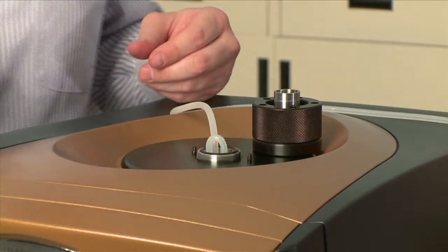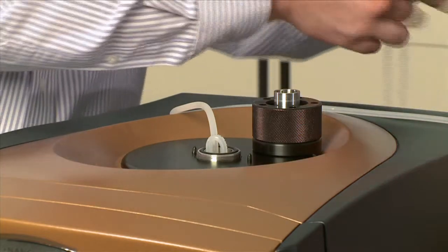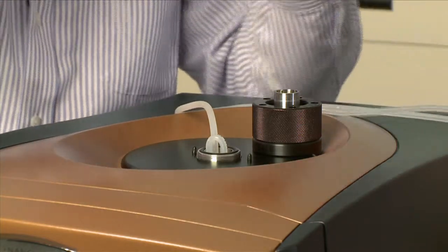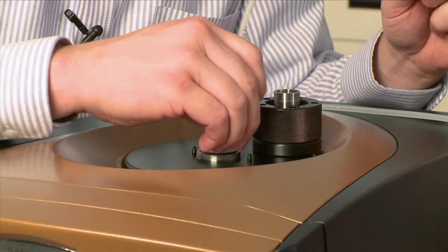Now I have one port open on the sample side to go directly to our waste container, which is where our vacuum is drawn from.